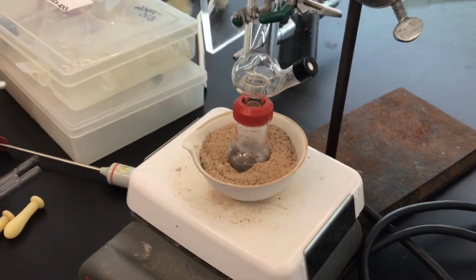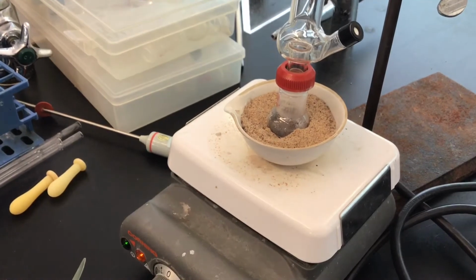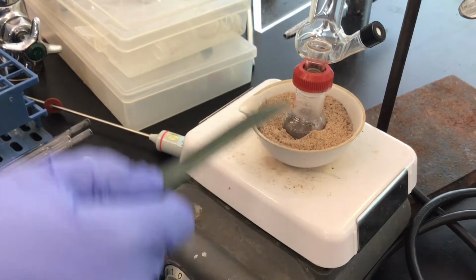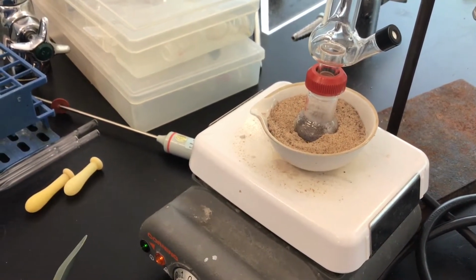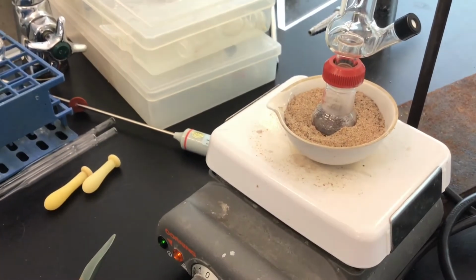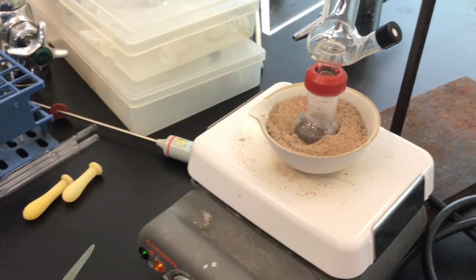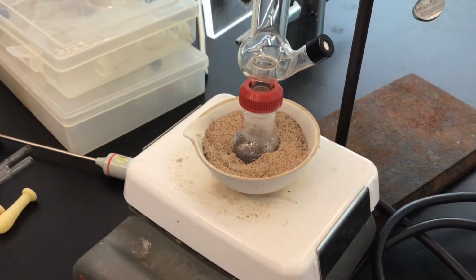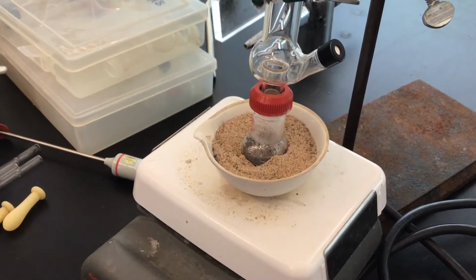And bumping, what I mean by that is that you can superheat a liquid, and if there's nothing that's stirring around, it could superheat and then bubble all the way up and out of your distillation setup. The technical term is sites of nucleation, and that could be, for instance, a crack in the glass, the stir bar itself, but in this instance it's going to be the cinnamon bark acting as that.